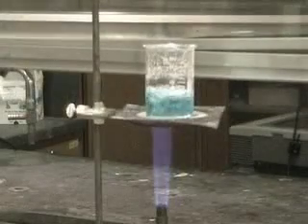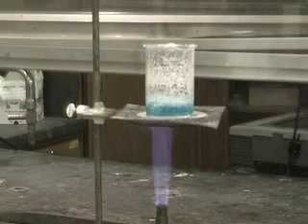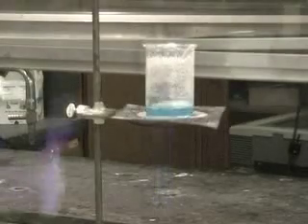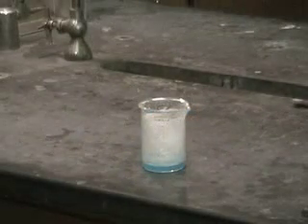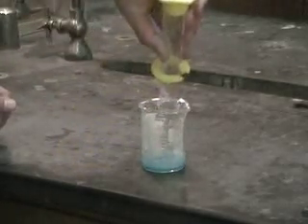Slowly, we begin to see a solid formed. The solid forms as the solution splashes up on the sides of the beaker and the solvent evaporates. We stop heating when the solution becomes cloudy because it is saturated with potassium nitrate. We add a little water to wash the potassium nitrate off the sides of the beaker and back into the solution.